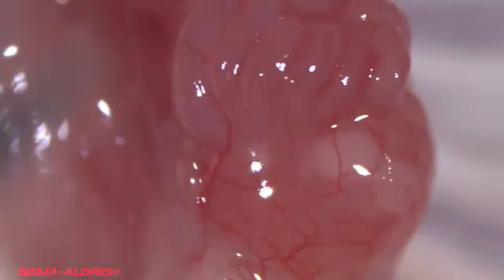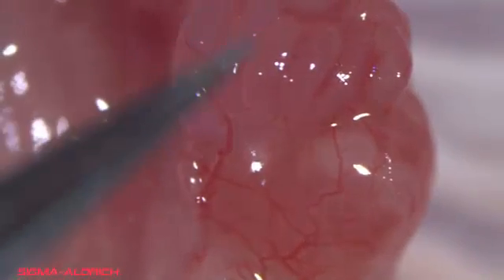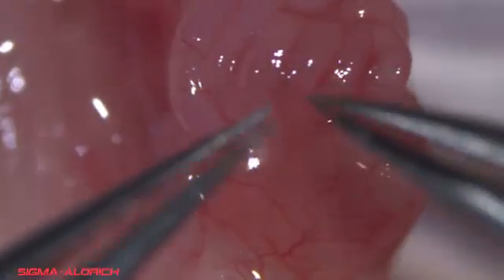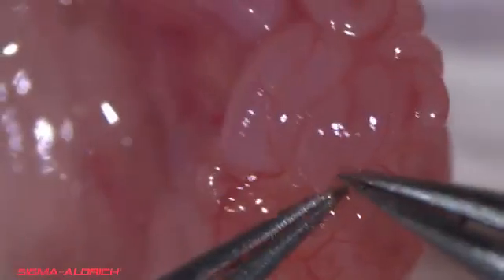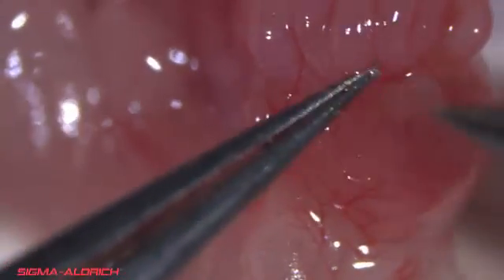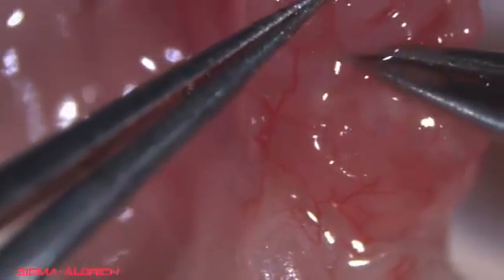Embryos should be transferred into the exposed oviduct. Begin by orienting the exposed organs to facilitate access to the infundibulum. Tear the bursal membrane and expose the infundibulum. Insert the closed end of a fine pair of forceps to confirm proper orientation and access.